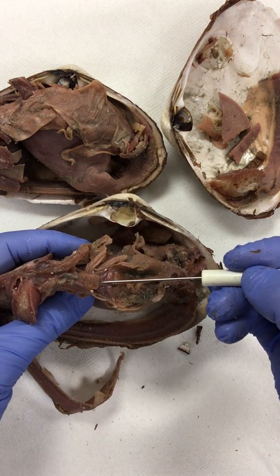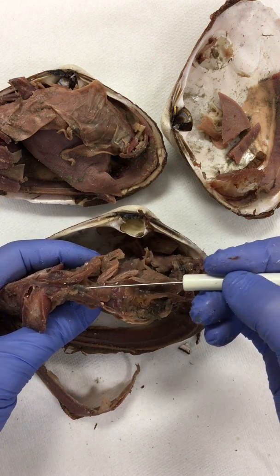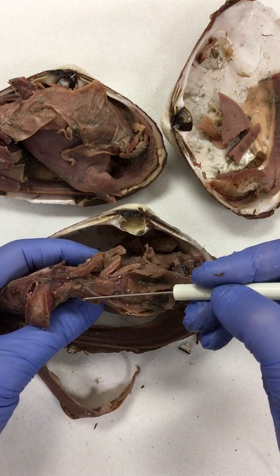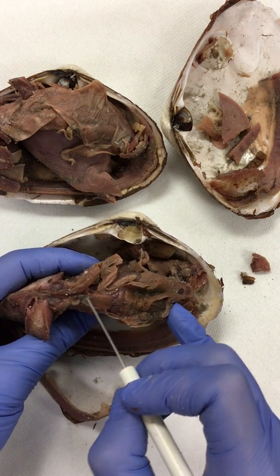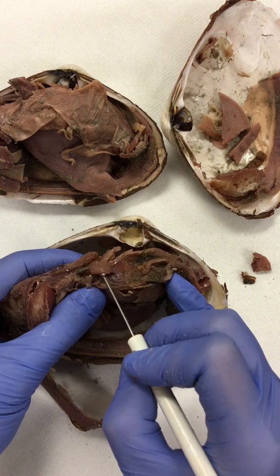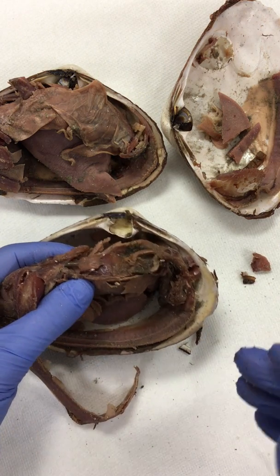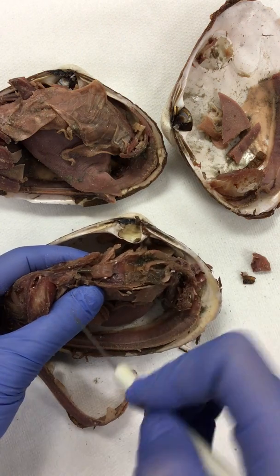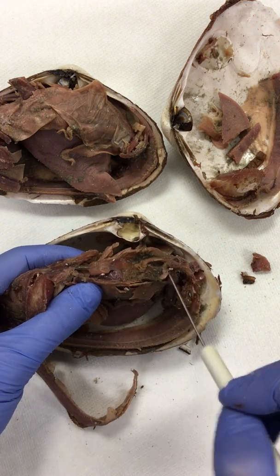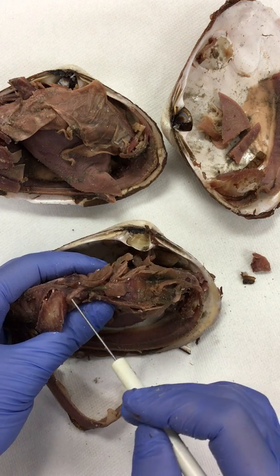Remember that they have an open circulatory system. You can see that there's a tube right here, and then you can also see that it's kind of green or darker in color there, and that is going to be the intestine traveling on the opposite side of the heart. So this region, this little bean, is the heart. In the open circulatory system, the heart contracts and helps to project fluids through the body to transport nutrients, and in this case also waste.